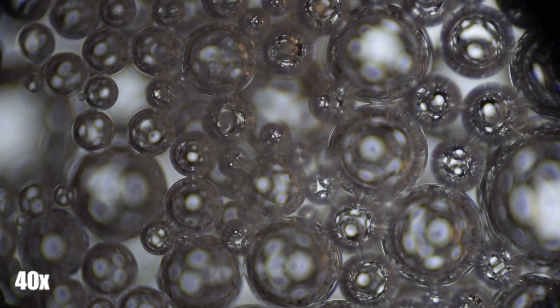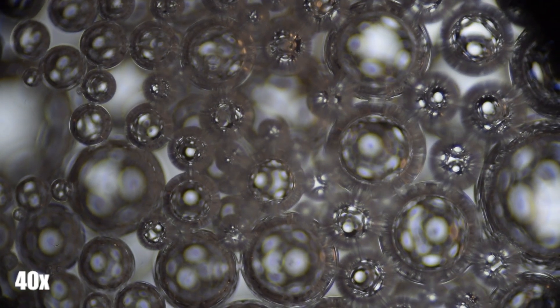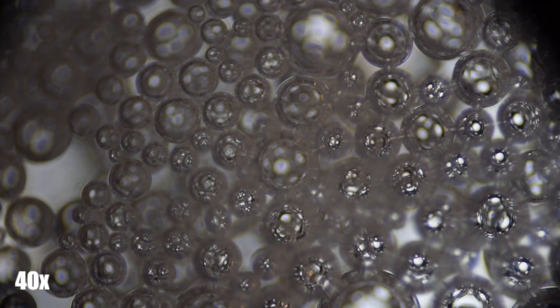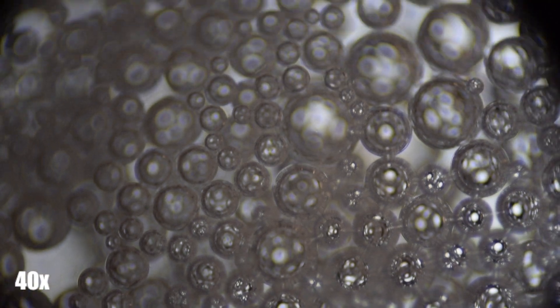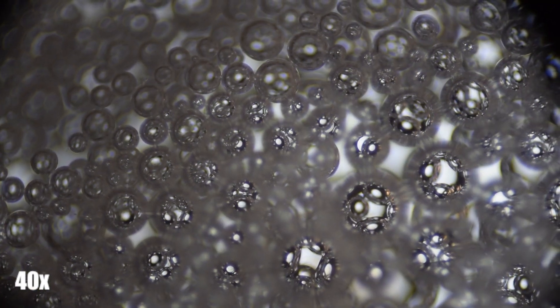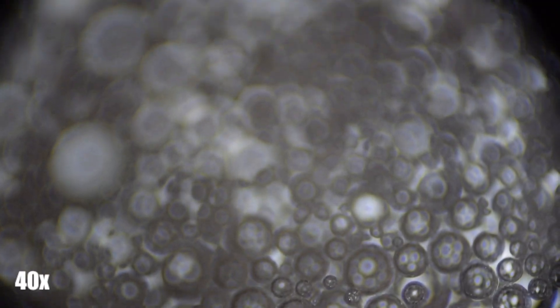Here are the bubbles formed between hydrogen peroxide and blood. While it looks odd to the human eye when we put it on cuts, it is microscopically beautiful.